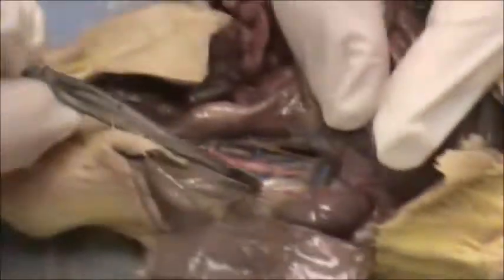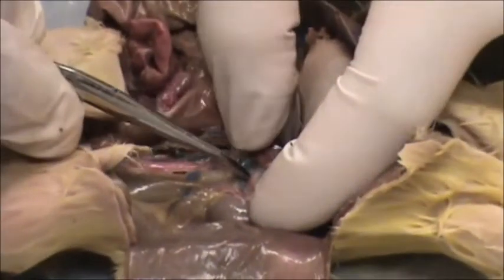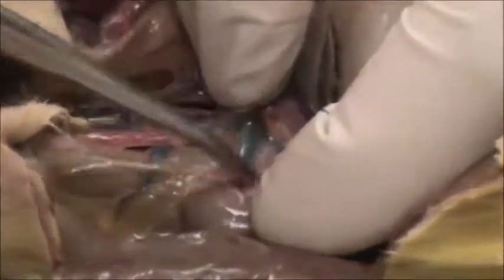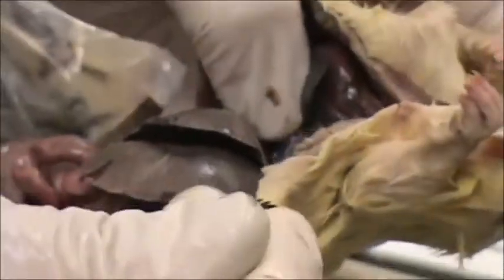This is a lumbar vein, which we're not concerned about, but right here this blue vein going into the kidney is called the renal vein, and above it is a thin red one called the renal artery, and these attach to the aorta and the vena cava. Up here in the liver you can find a blue one called the hepatic vein, and underneath the lungs you can find the thoracic aorta.